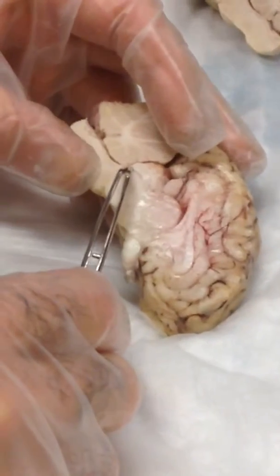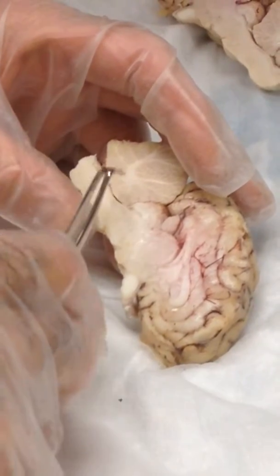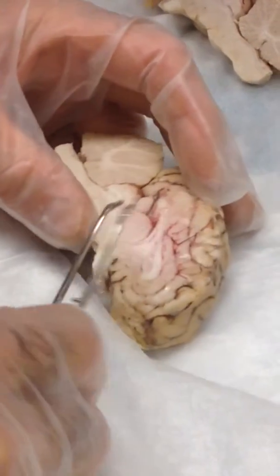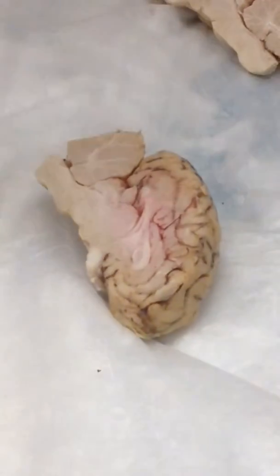This little flap here, that's the anterior medullary velum. It just marks the end of the fourth and the beginning of the aqueduct. That aqueduct, this is good light. If you just roll it, you can see that there's shiny and not so shiny. The third ventricle is like this.